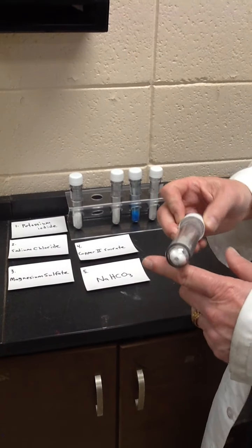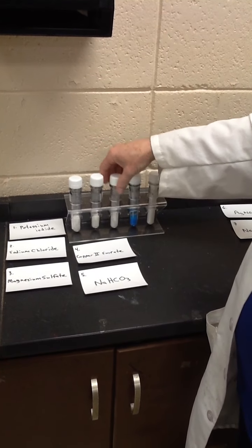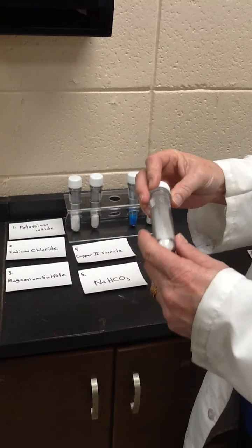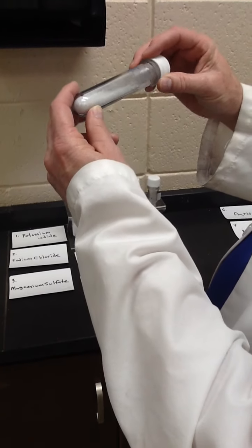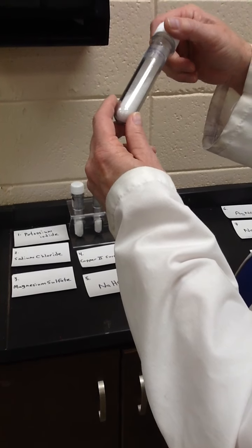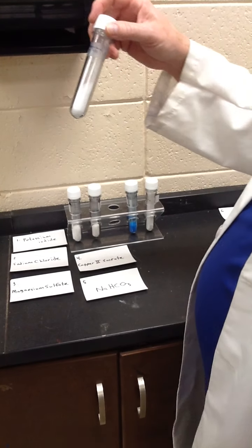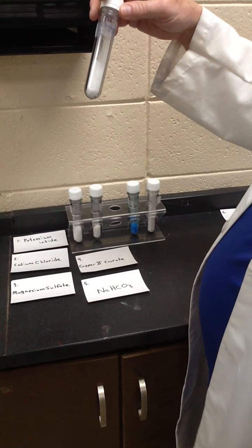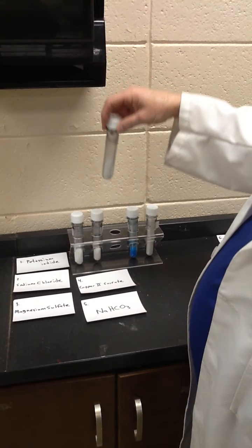Sodium chloride. And if you see, it's a fine crystalline powder. If you haven't seen it under the microscope, I'll set one up. It's amazing to see. In a somewhat more transparent, clear, larger, chunkier crystals, we have magnesium sulfate. You can buy this at Walmart as Epsom salts.